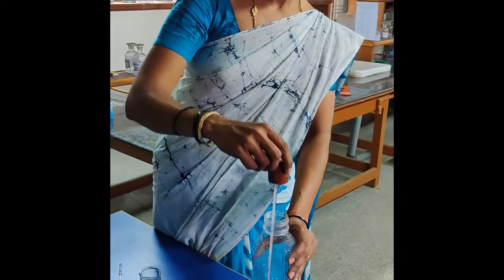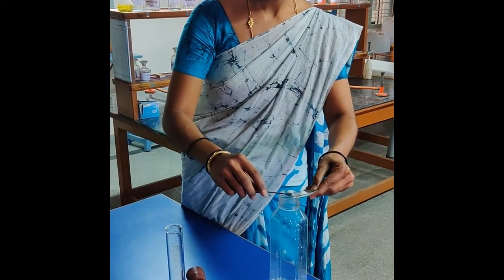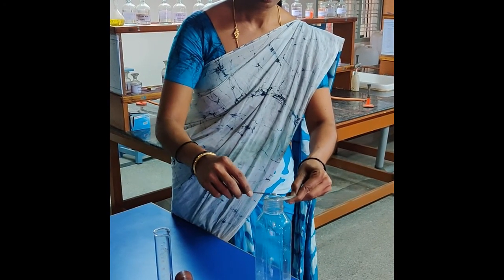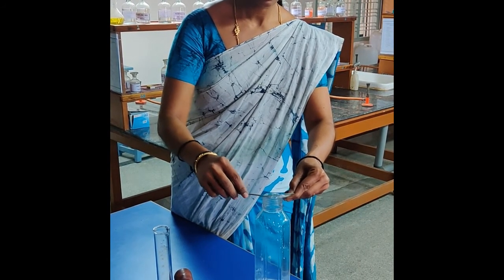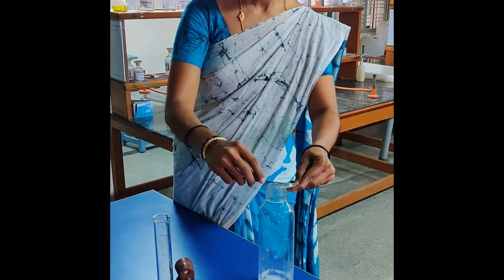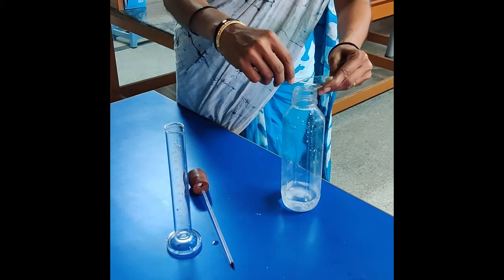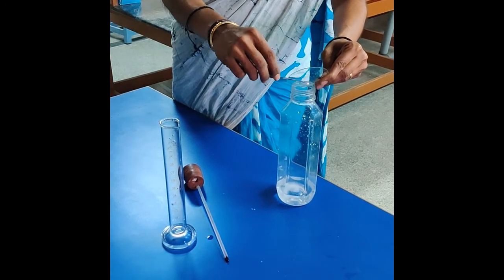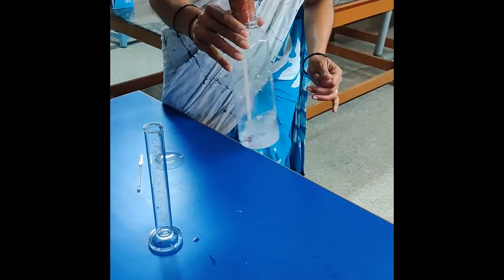Now that the temperature of water is noted, I will remove the rubber cork and add the 5 grams of potassium nitrate that I have already weighed — it is exactly 5 grams. Care should be taken that it is not spilled out, as that would affect the result. I have added the 5 grams of potassium nitrate. Immediately let me stopper the bottle and stir until the salt is dissolved.